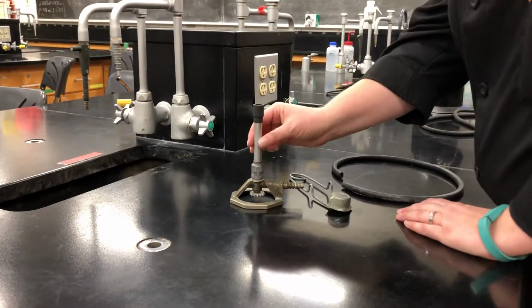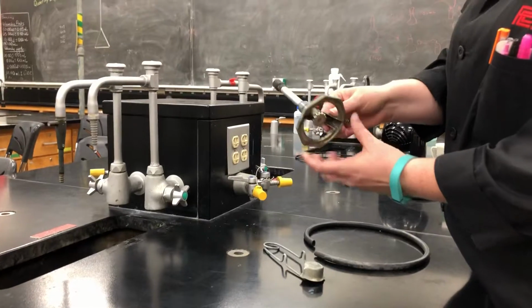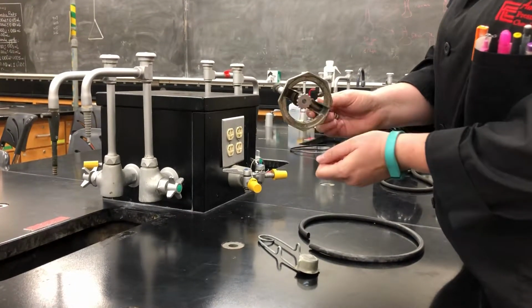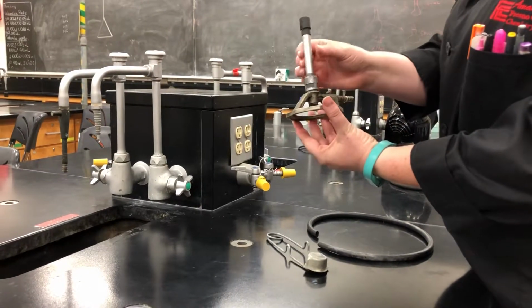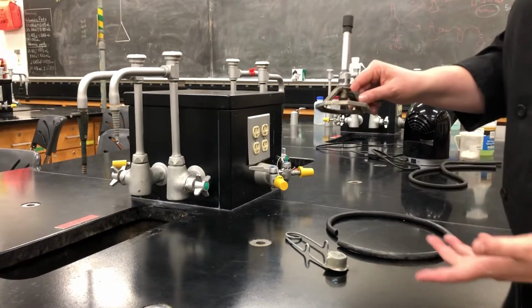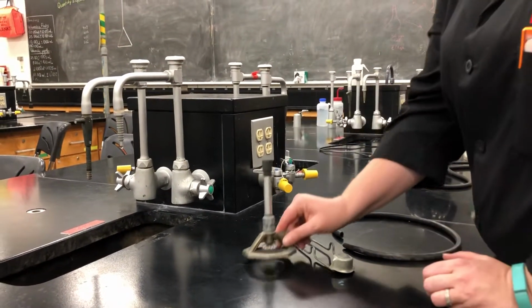With our Bunsen burner, we want to make sure that the valves are open. So on the bottom, there's a valve that adjusts how much gas gets into the Bunsen burner. And on the stem, there's a valve that adjusts how much air gets into the Bunsen burner. And you just want to make sure that they can both move.